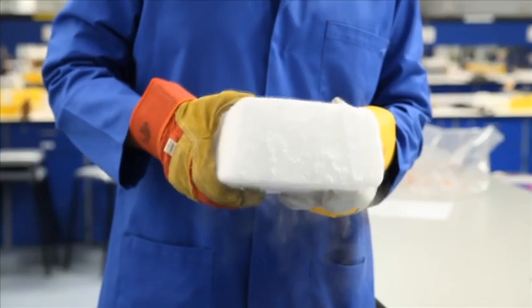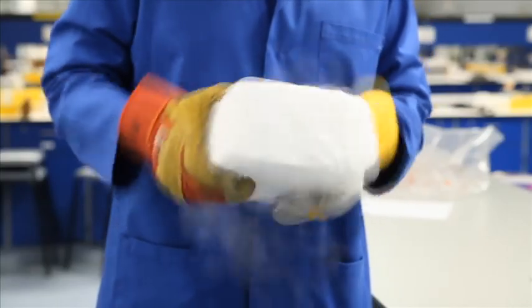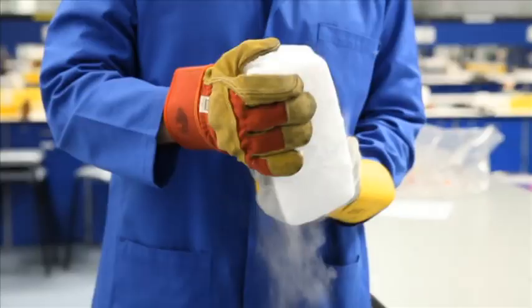You'll need some dry ice. You can obtain it from regular cryogenic or gas suppliers, and it comes in 10 kilogram blocks like this.